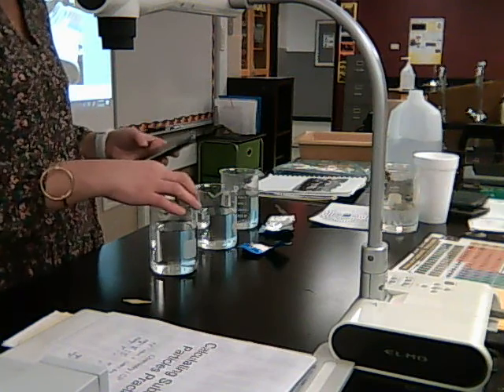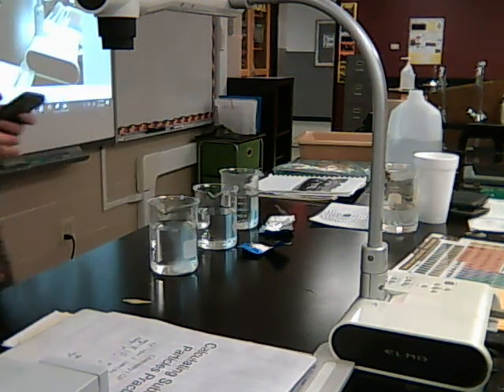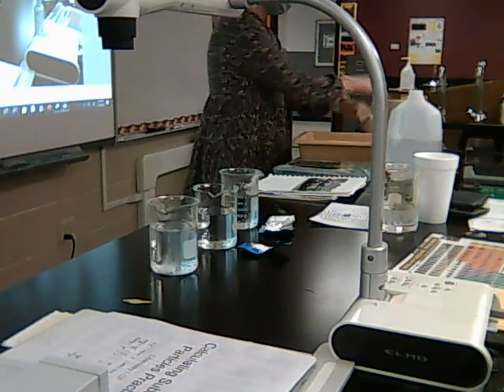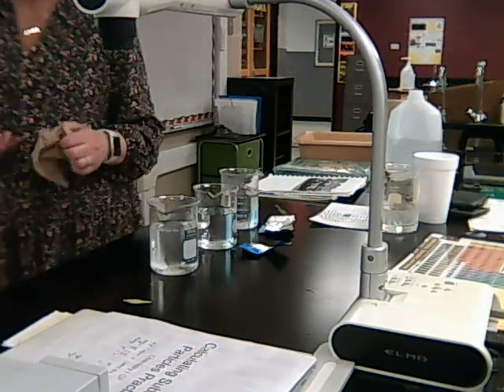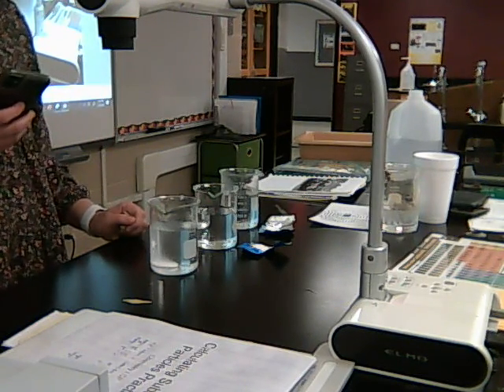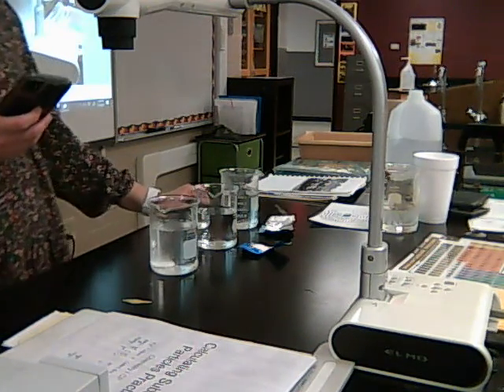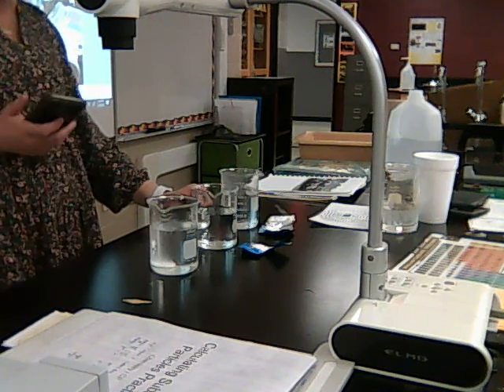Okay? So there we go. You can kind of see it's bubbling there. It's going pretty slow, right? This might take a while.